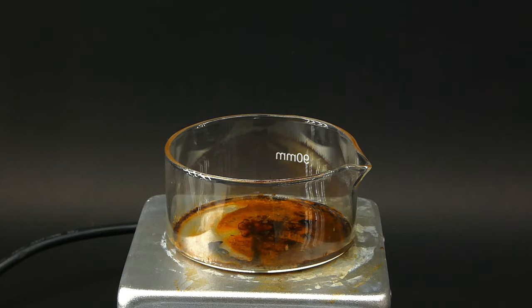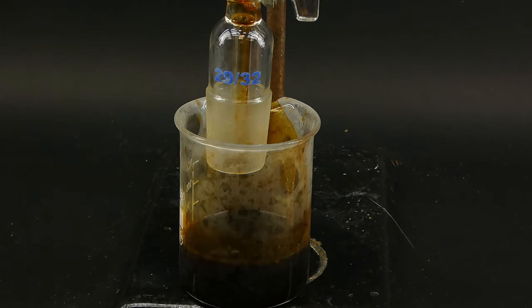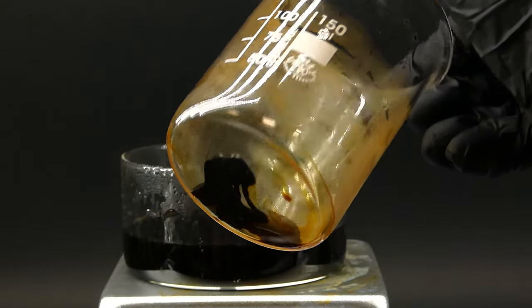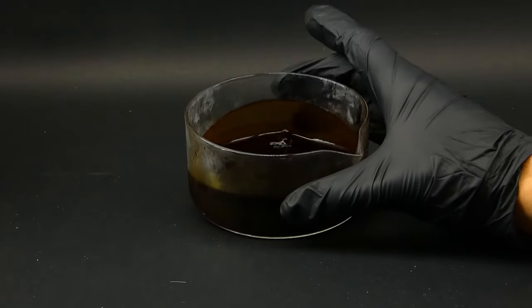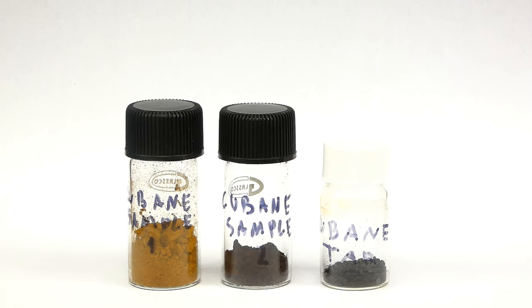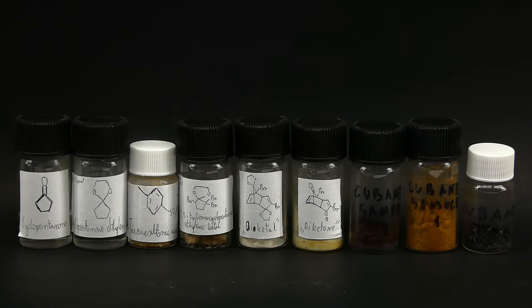I am really confident that I made cubane here, because pretty much every reaction went as it should — but at the last step I just screwed up. To try and salvage the cubane I extracted it from the column and decided to try to just crystallize it out. I boiled off all the eluent, then tried to dissolve everything in some methanol. While I was mostly successful, there was some insoluble tar left — which happened to be the most perfect instance of tar I've managed to create so far. I cooled everything in a freezer and something did crystallize out as a brown powder. I also noticed that adding water to the remaining solution caused something else to precipitate, so I filtered that out as well, leaving me with two weird products plus some tar. I don't know which one contains the cubane — maybe they both have it or it was in the tar all along — so I'll be taking these samples along with most of the intermediate products to be analyzed using NMR.